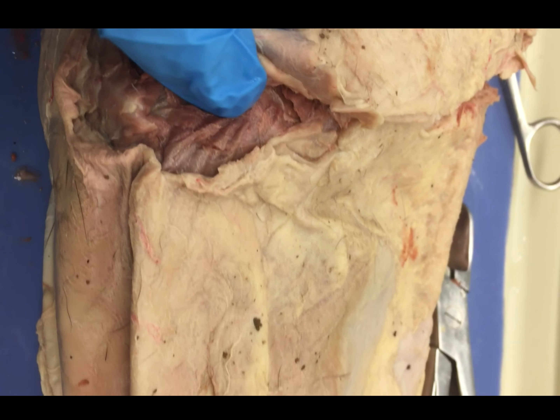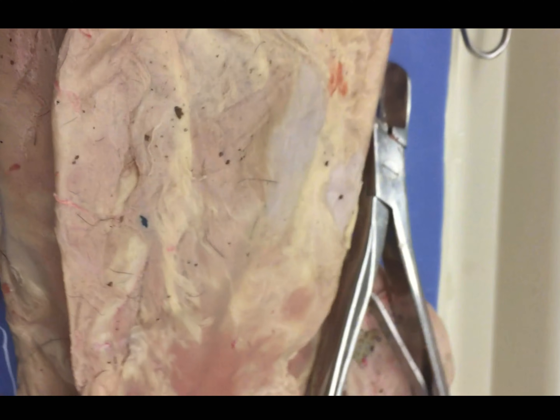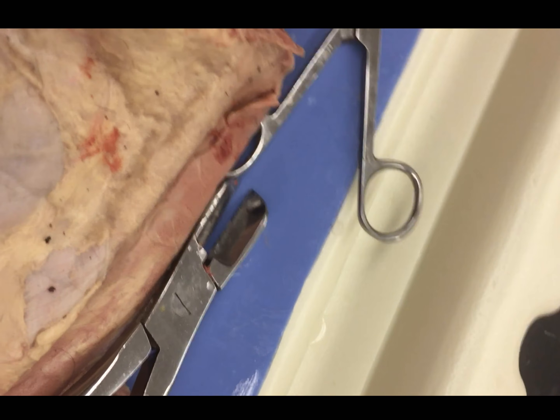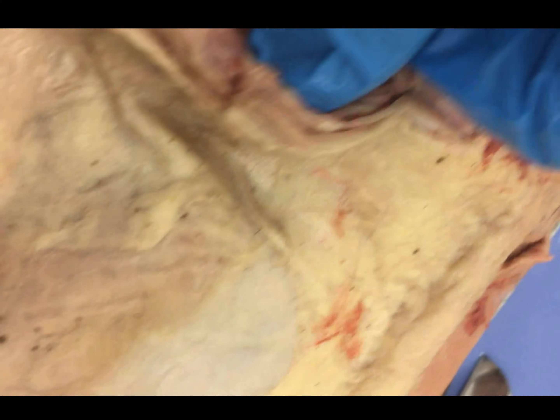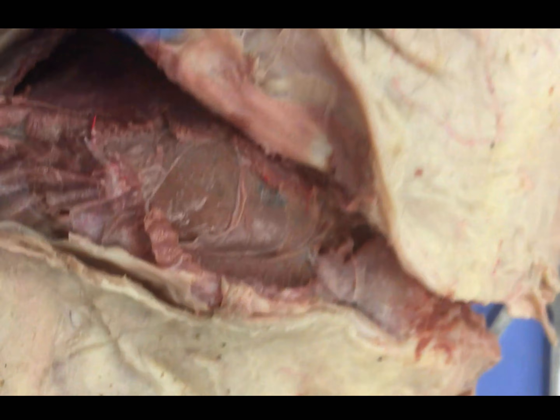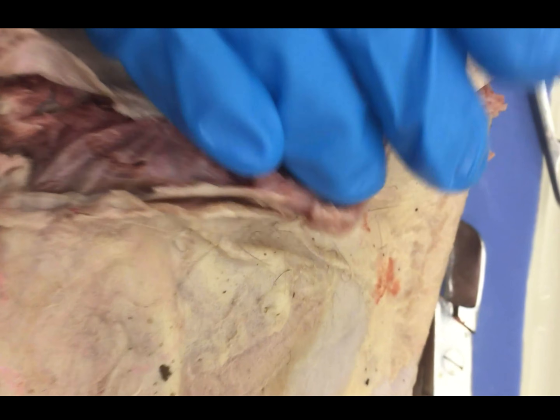This right here is the diaphragm. If you cut in and you get a little too far — and I actually didn't so I can't quite show it to you yet — but if you get in too far, you're going to see intestine or liver. If you see this, you've gone too far inferior and you're going to want to move up a little bit before you make your full cut across.